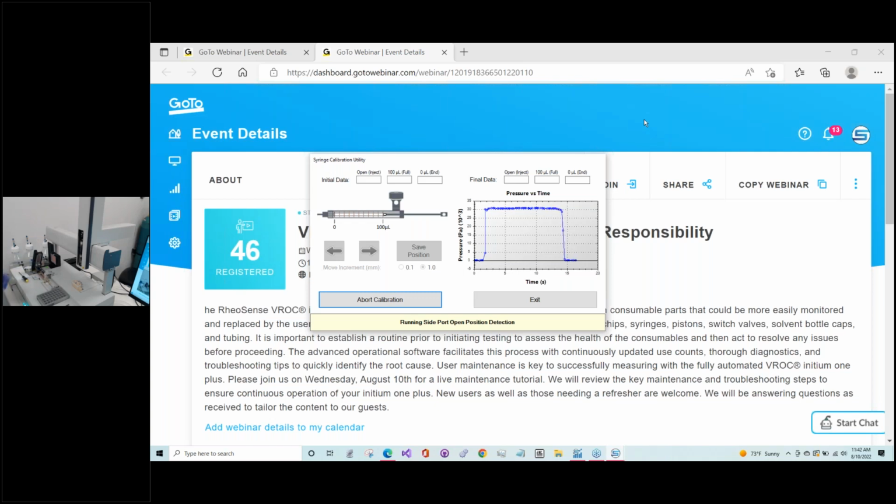So much of this you do nothing until the end, and while that's finishing off, the role that you'll play when you're doing the test syringe calibration is basically confirming that the tip of the piston is at the 100 microliter mark on the Hamilton syringe. And don't be misled by the schematic on the screen. That's not a real-time view of where the piston is. That's basically showing you what you want to achieve on your actual system.